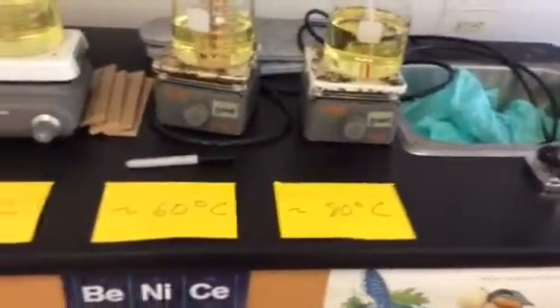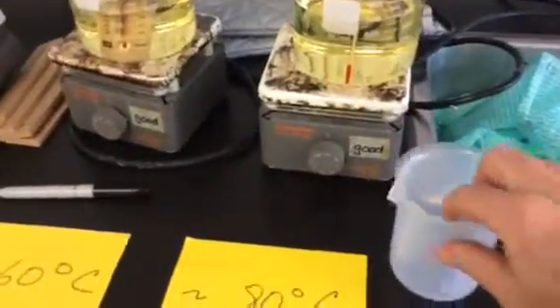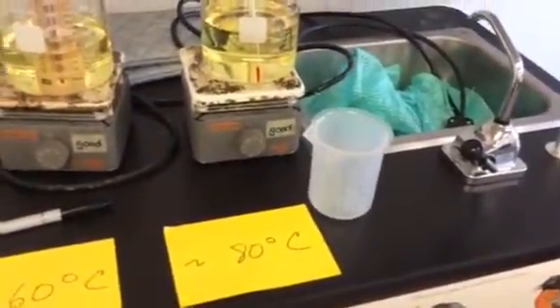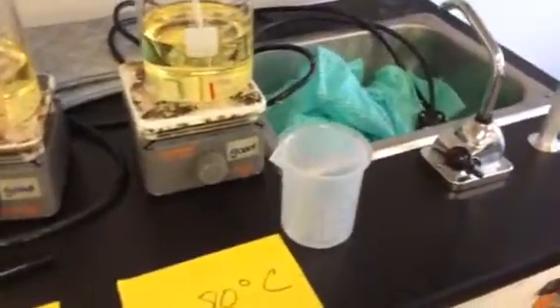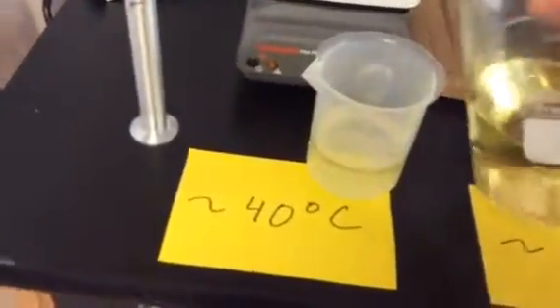When you work in this area here, before you get your sample, you will call me over. So the learning manager will pour the oil out for you. Now, this does not have to be exactly measured. So the amount of oil you're going to get each time is 60 milliliters. We want to have a little bit more oil than we're actually going to measure because that will reduce one of the variables. As the oil runs out, if there's a small volume left behind, it tends to affect how fast it runs out of the container. So we'll always get 60 milliliters. So you'll come over here, and then I will probably don some hot mitts, and I'll pour you a sample of the oil, and I'll give you about, hopefully, just over, whoops, that's about 100 milliliters, but for our video purposes, we'll run with it.